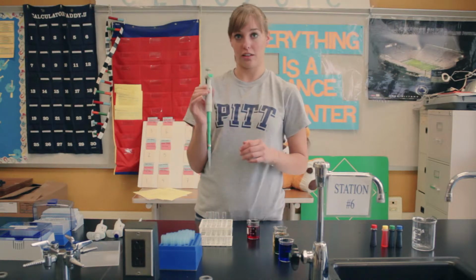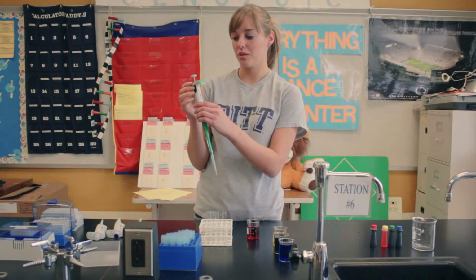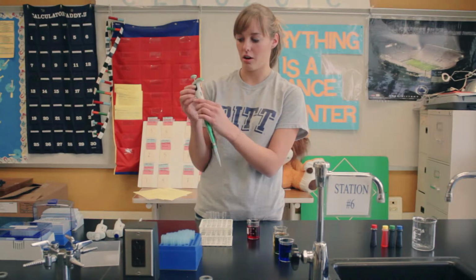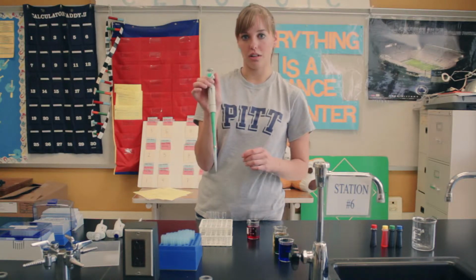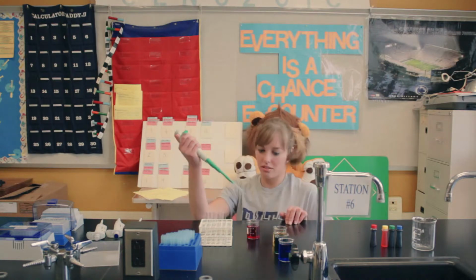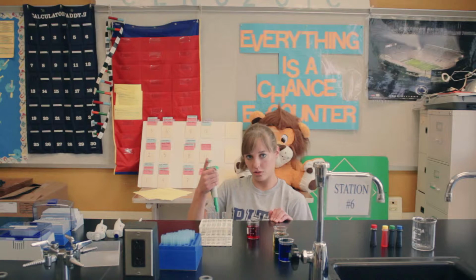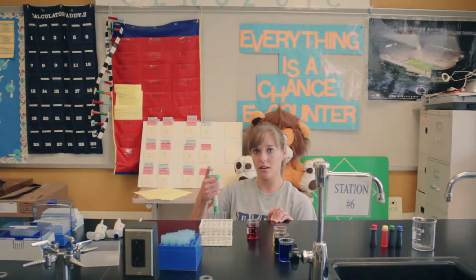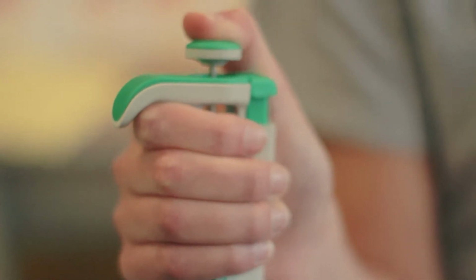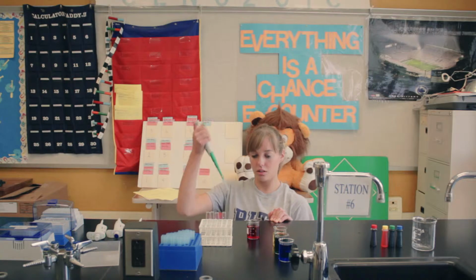The micropipette takes different measurements of microliters. And to change them, you can either use the top or right down here, the black knob. This one is currently at 670. And to take a sample, get down at eye level. And there are 2 stops when you push down on the micropipette. There's the first one, and then if you push all the way down is what you use when you release the sample. So you can only go to the first one.